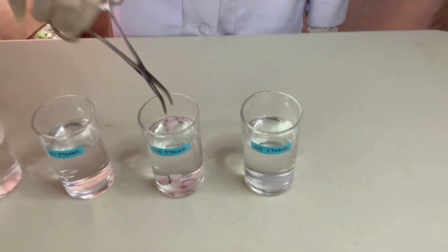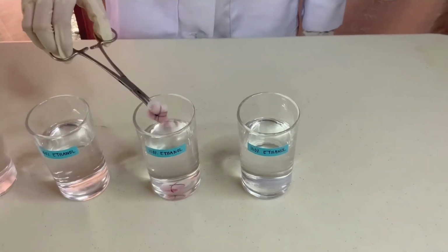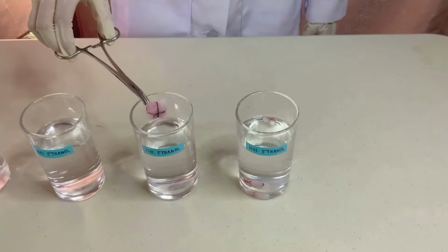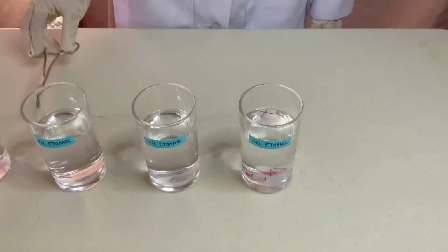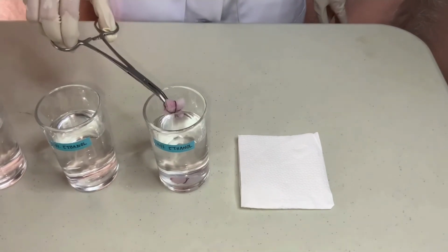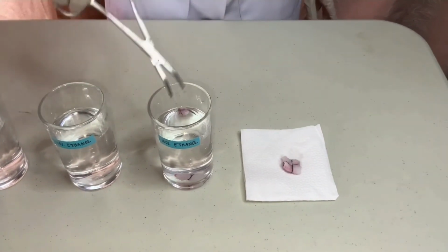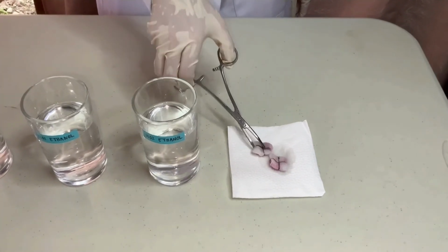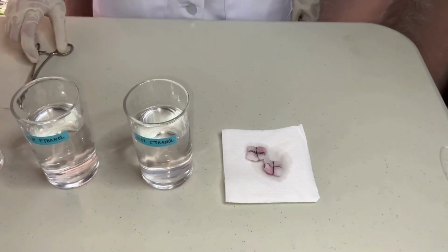After 30 minutes, we still immerse the tissue in absolute ethanol but in another container for 45 minutes. After 45 minutes, at this point, all but a tiny residue of tightly bound water should have been removed from the specimen. Now we drain our tissue and proceed to the next step, which is clearing.